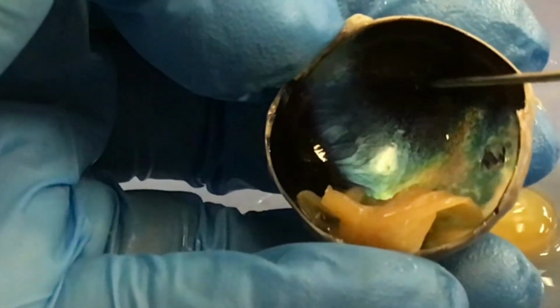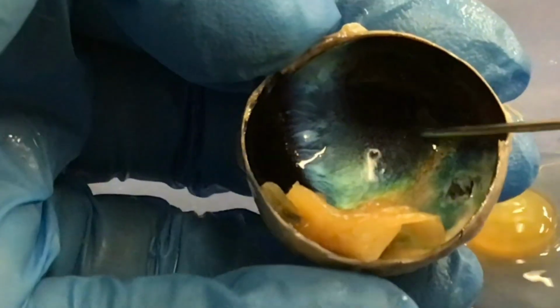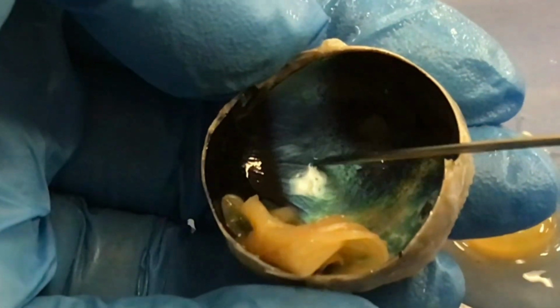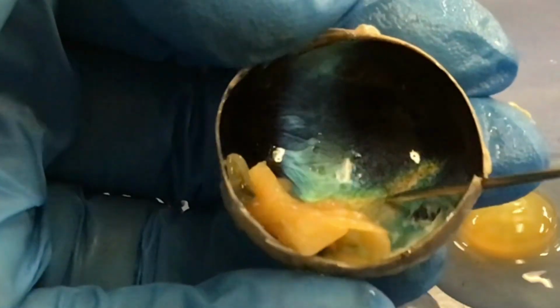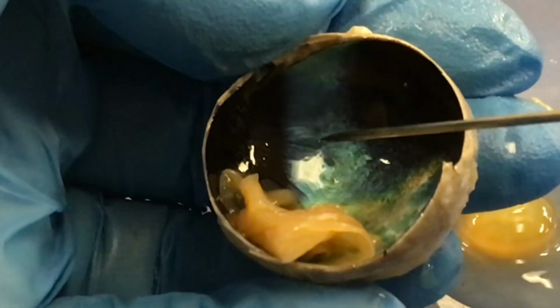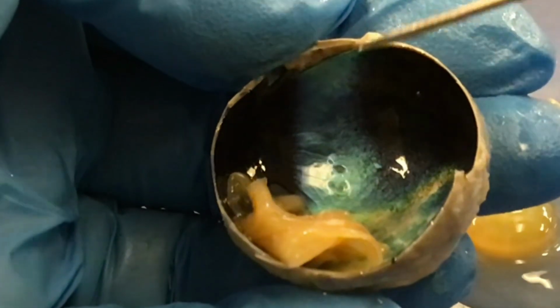That is the choroid, the middle layer of the eye, or the vascular tunic, because it has blood vessels. And then this opalescent little structure here, this is the tapetum lucidum. We would see this in animals like dogs and cats, and this is a sheep.